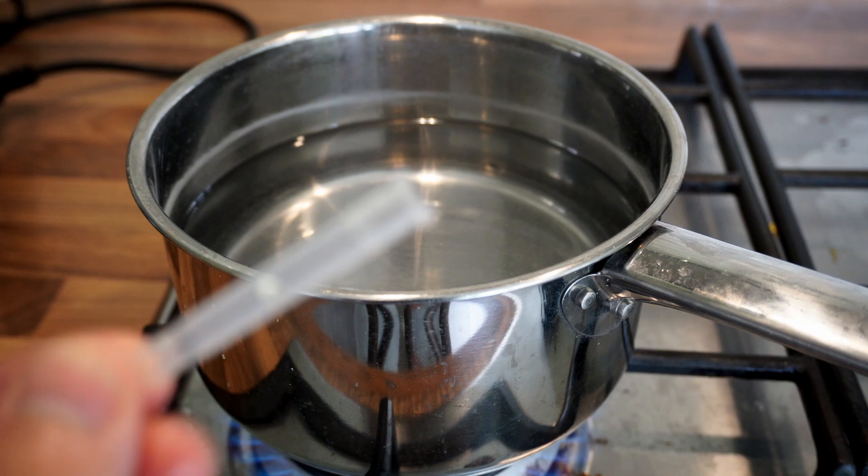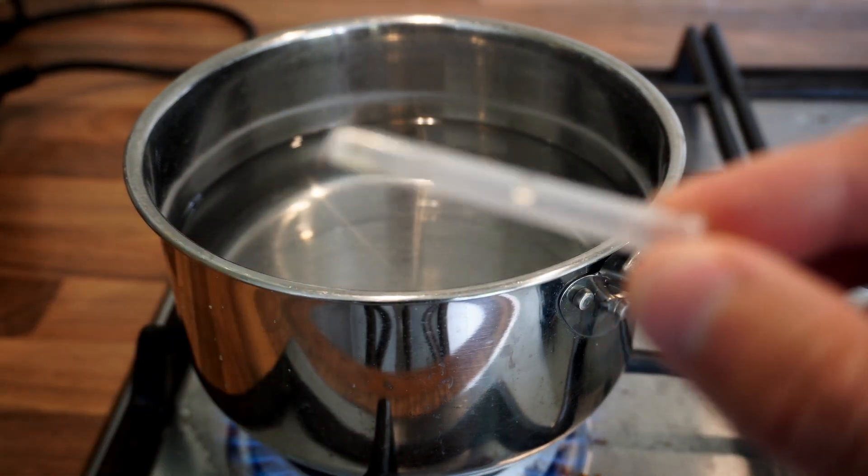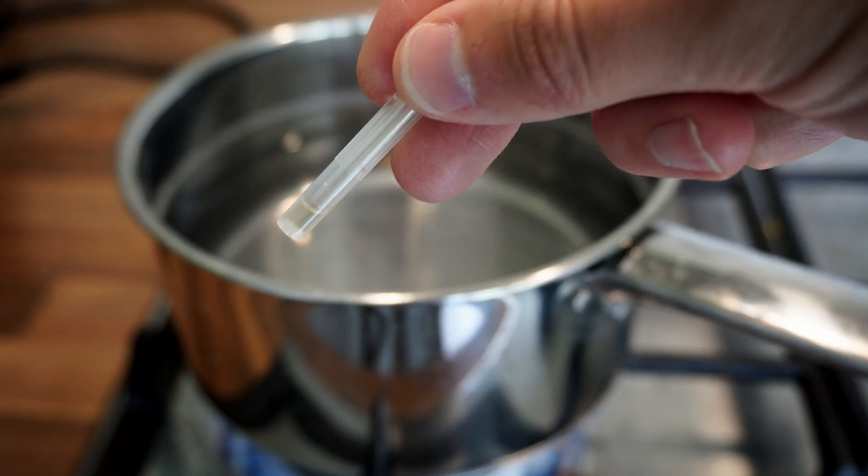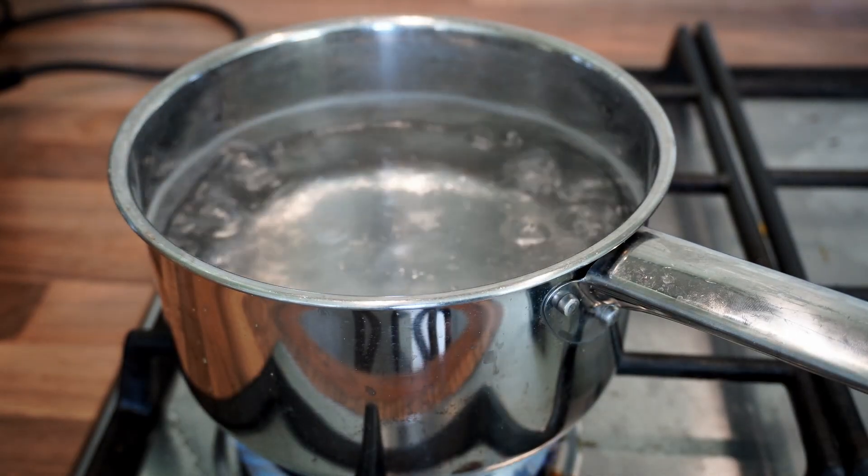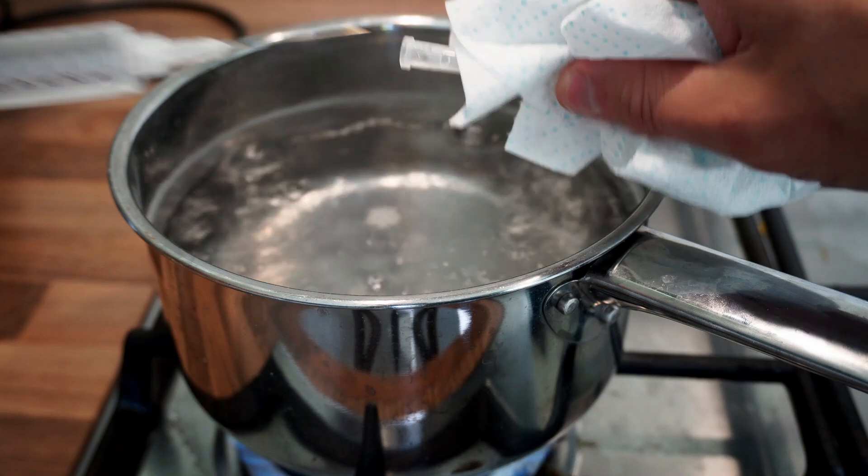Next we are going to clean the inside of the cap because you can see here that it's quite dirty. To clean the cap we're just going to draw up some boiling water and then squirt it into the cap and give it a shake.